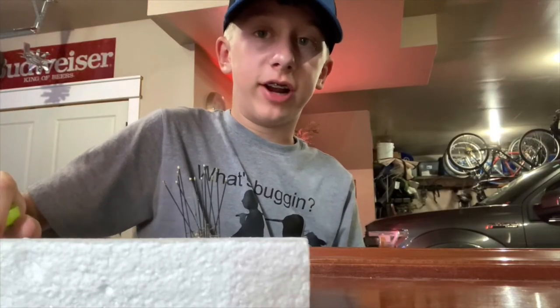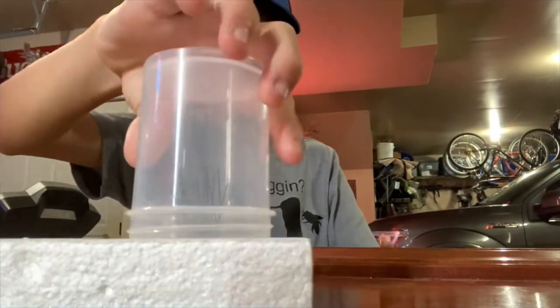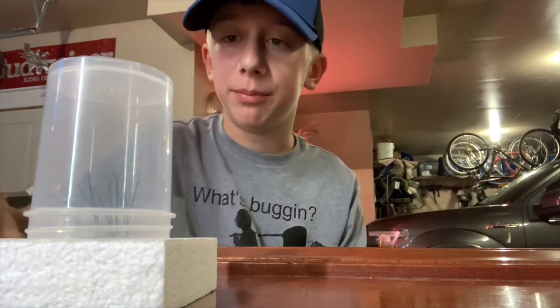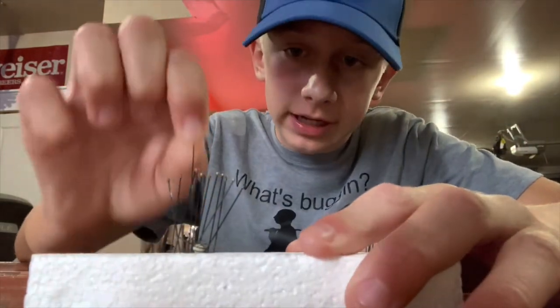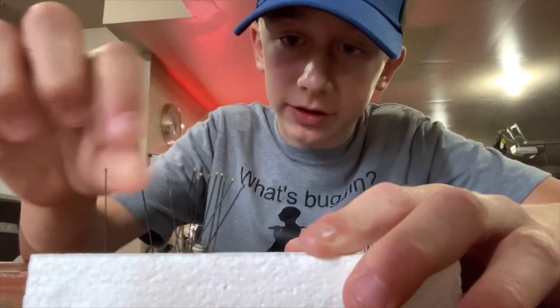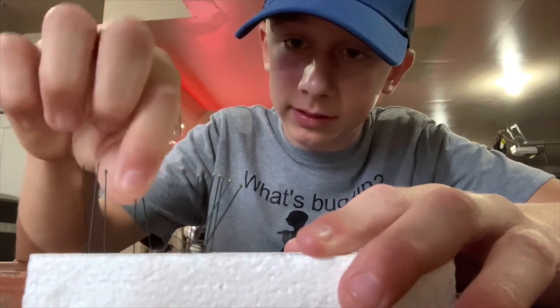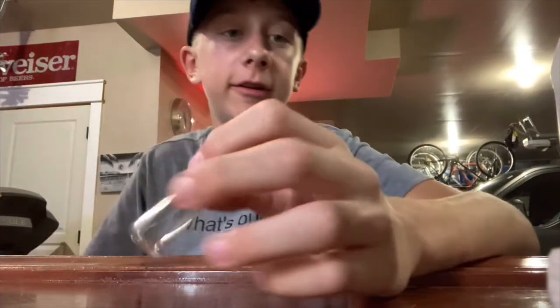I don't want it to completely dry out, so I'm going to keep it here for probably 20 minutes or so. I'm going to put a cover over top so no other insects try to eat it. I've got the black widow here, so I'm going to remove each pin. It should be sort of held in place enough that it works. Here's what you're going to need for an alcohol specimen.